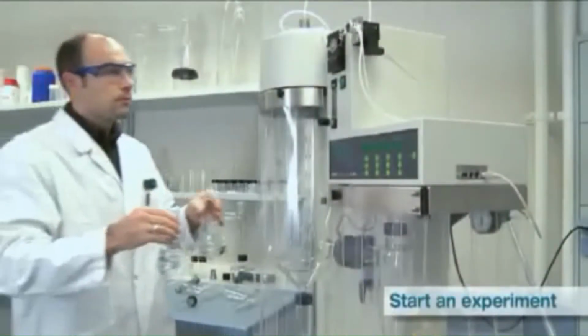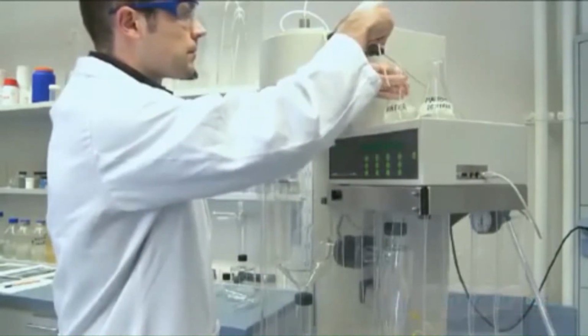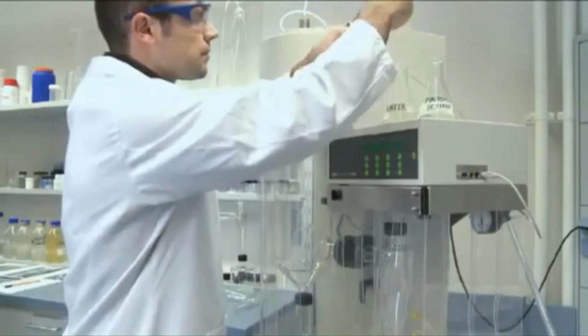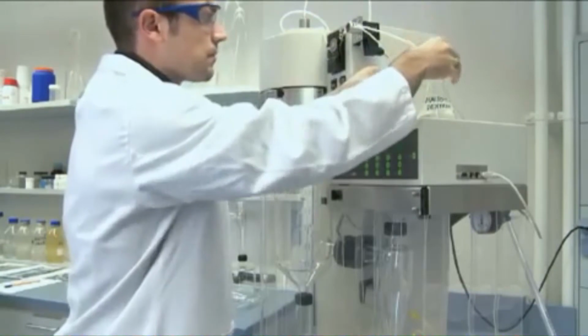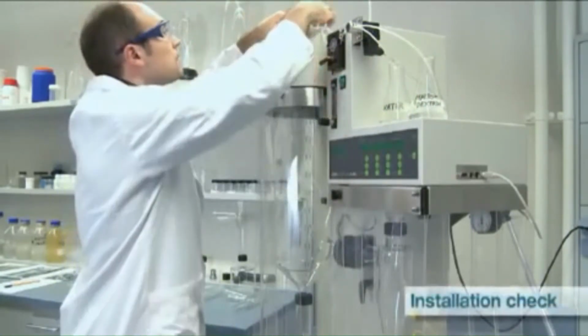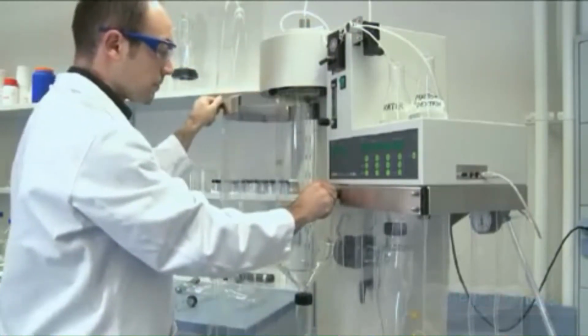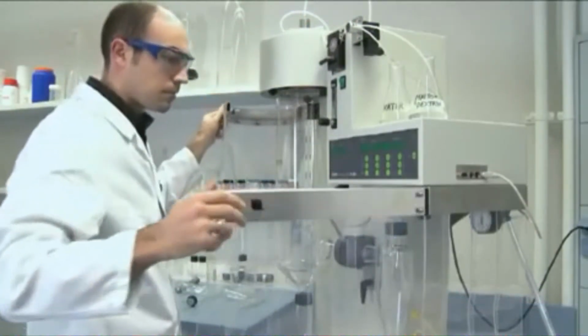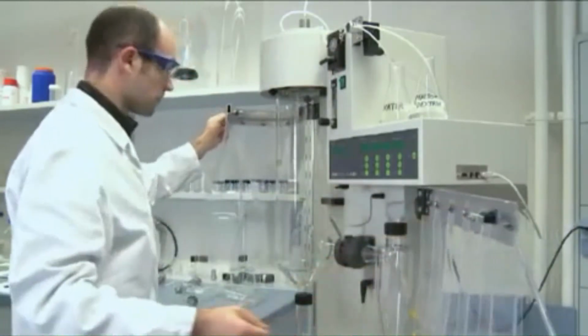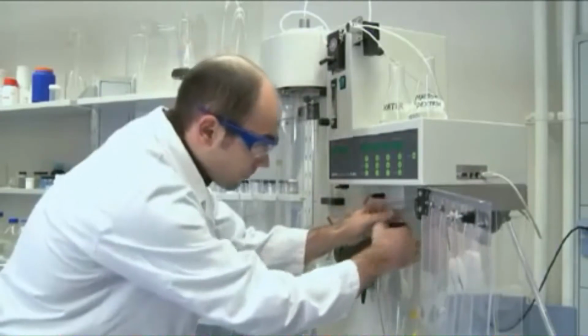This is an example of how spray drying device works for this experiment. Firstly, the milk solution sample and distilled water will be placed in containers, which then will be put onto the spray dryer. The feed tubes then will be put into the sample and distilled water each. Then the peristaltic pump will be closed and the connections at the nozzle will be checked. After that, for safety and precaution, all joints of glass parts must be ensured that they are all tightly sealed.